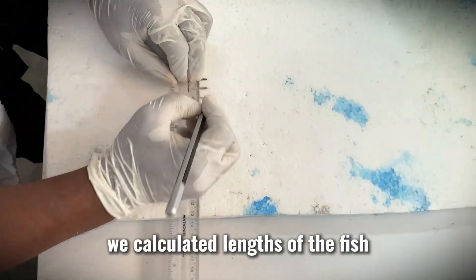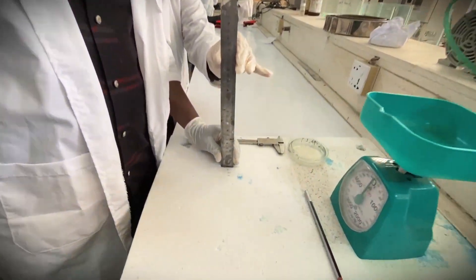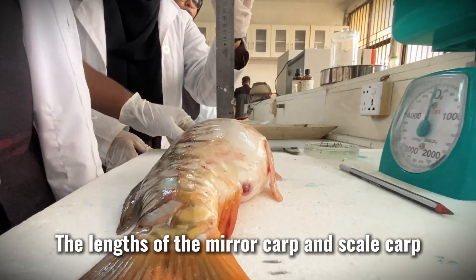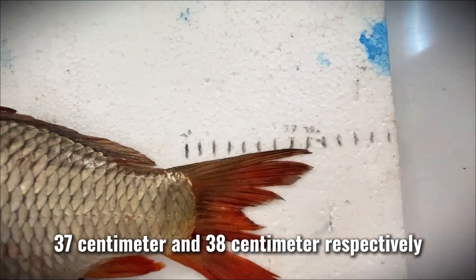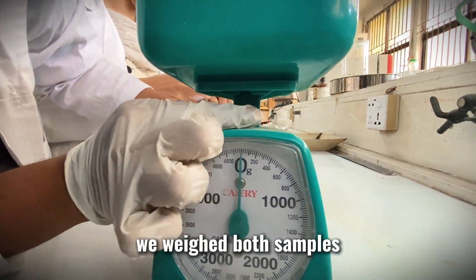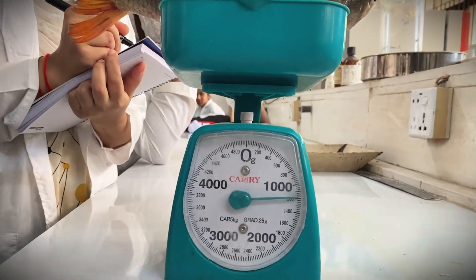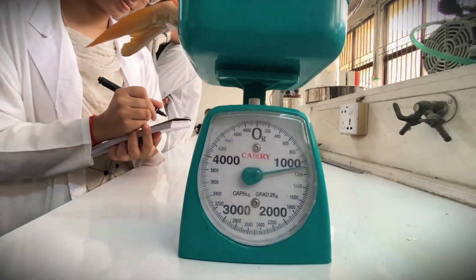Before dissecting the fish, we calculated the total lengths of the fish. The lengths of sample 1 and sample 2 are 37 cm and 38 cm respectively. After setting the weighing balance properly, we weighed both samples. The weight of sample 2 is 1170 grams and for sample 1 the weight is 1090 grams.